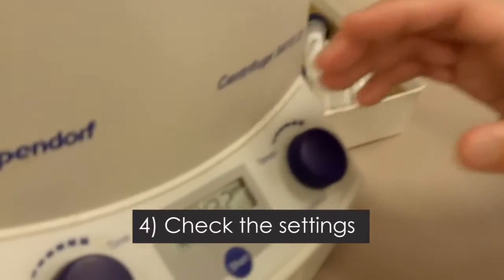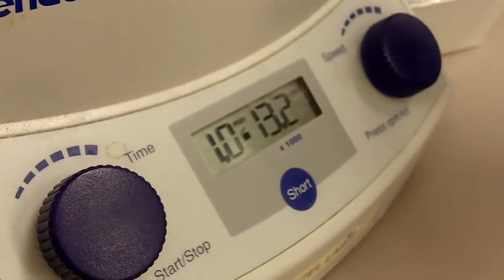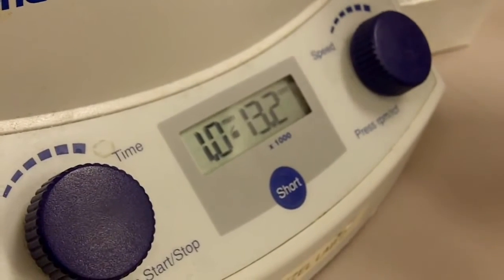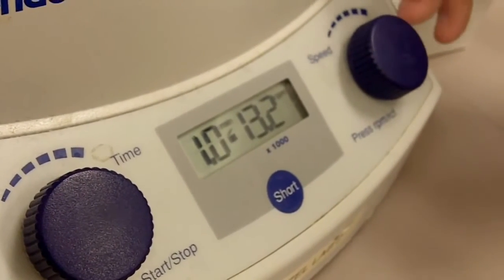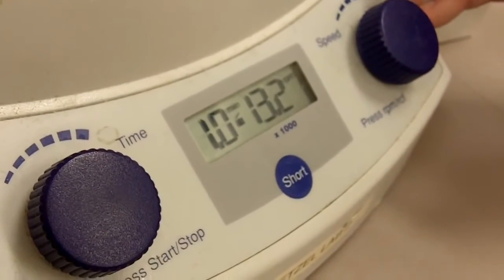The last thing we need to check before we use the centrifuge is to check the settings. There are usually two settings. One is time, the other one is speed. Time isn't really that important here, but what's most important is the speed. You want to make sure the centrifuge is set at a speed that is not going to break the tube.